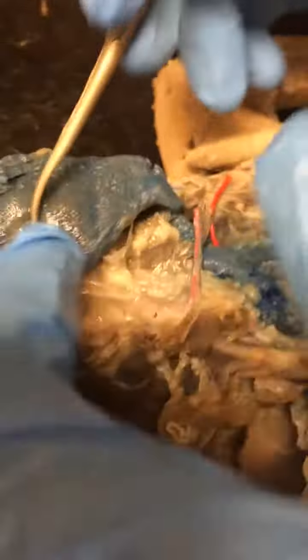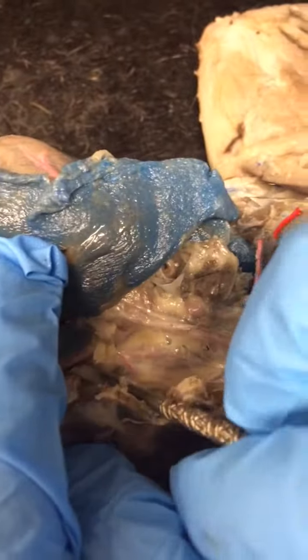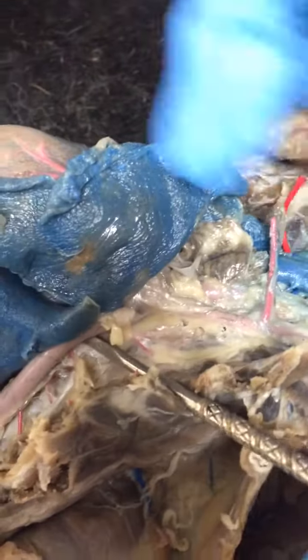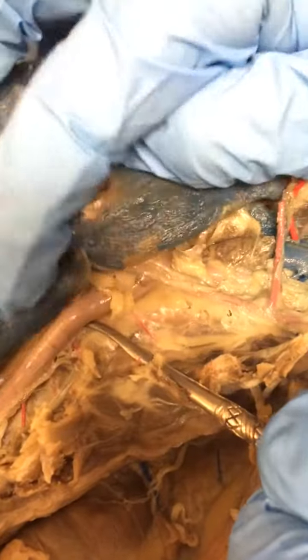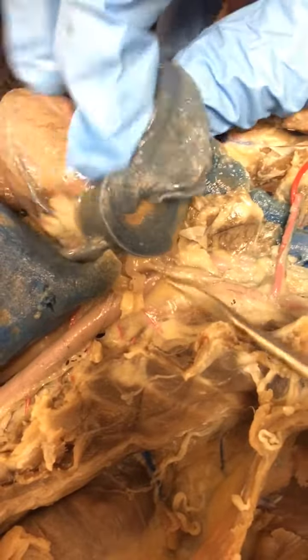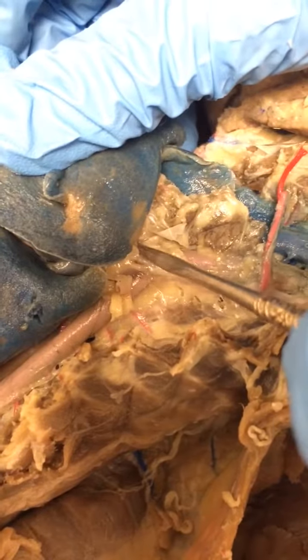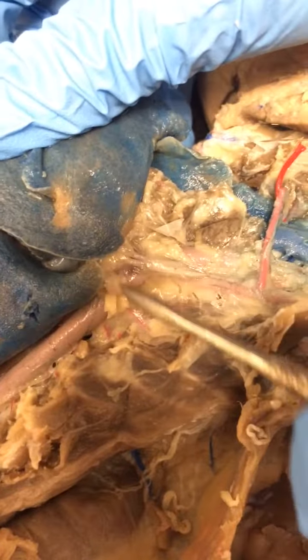Can we go over the aortic arch again? Sure. So the aortic arch. So you can see the aorta, right? You see this big kind of tube right here? If I just move that away, you see this big tube? The aortic arch is going to be just where that aorta kind of pokes into the heart, all right? So if you see anything poking into like this top part of the aorta, maybe right here or so, that's the aortic arch, all right?